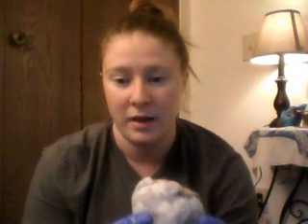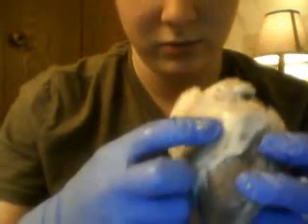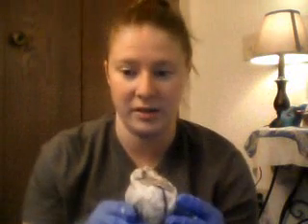So, if we look inside of the ventricles, we can see the trabeculae carneae, which are the muscles at the bottom, if you look down here. And if we check out in between the two sides of the heart, if you look in the middle, you can see there's a dividing wall, and that is called the interventricular septum.